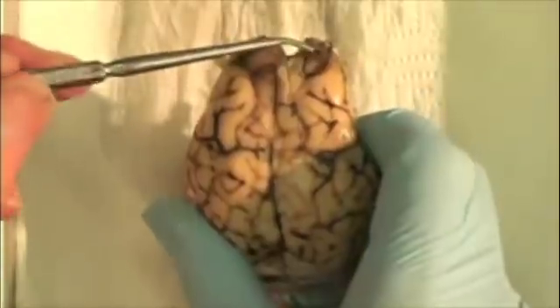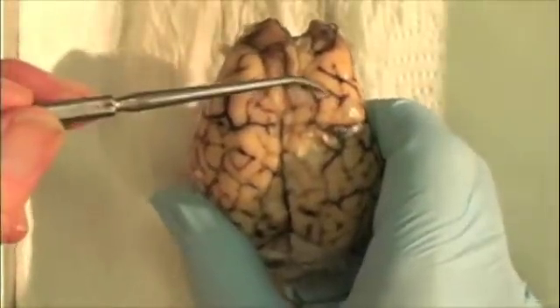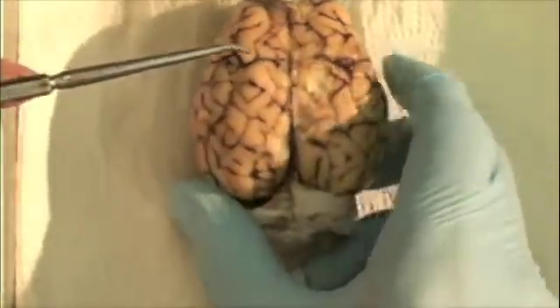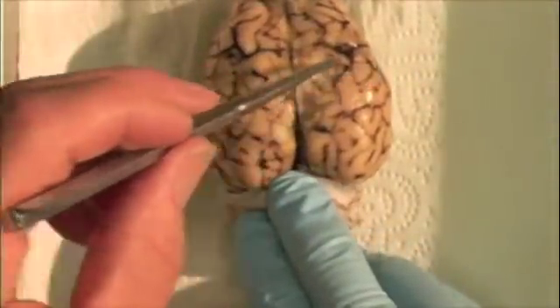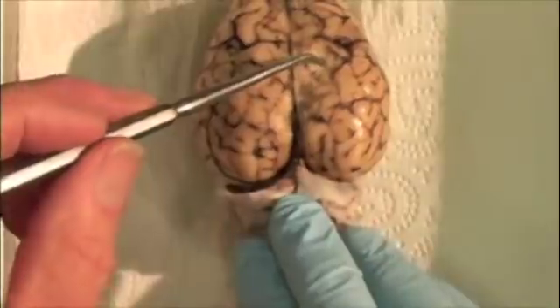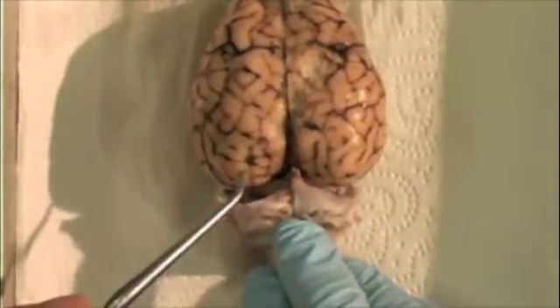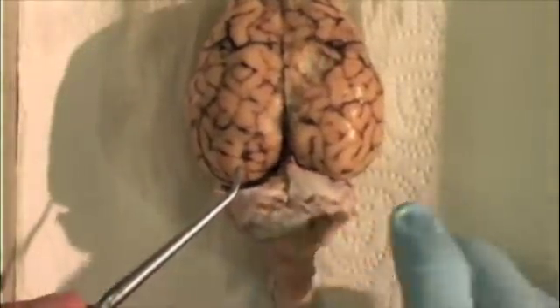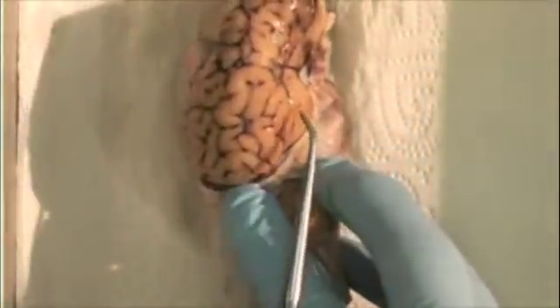Each cerebral hemisphere has four lobes: the frontal lobes, the parietal lobes, the occipital lobes, and on the sides, the temporal lobes.